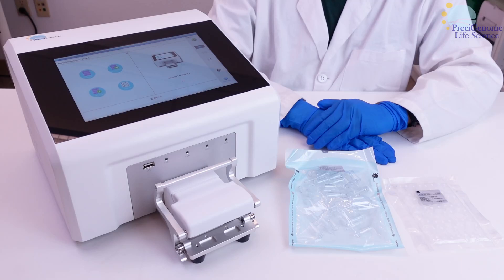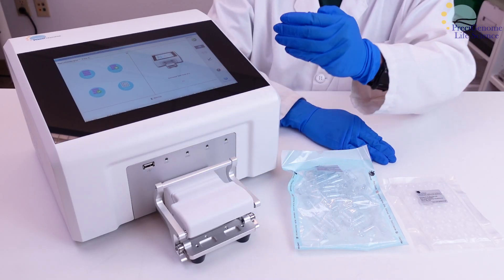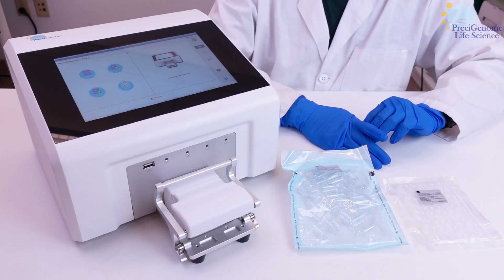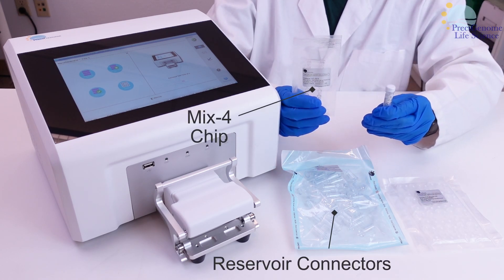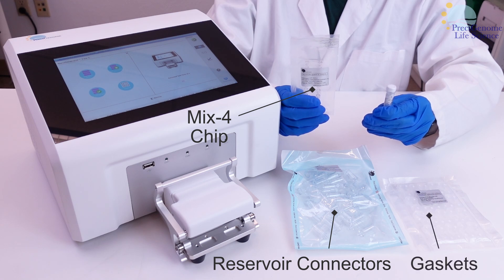In this video, we will go over operation of the nanogenerator FlexS. Used for nanoparticle synthesis, it comes with a Mix 4 chip, reservoir connectors, disposable gaskets, and a lipid demo test kit.